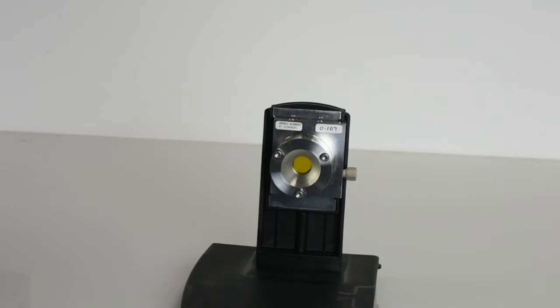The cell has three ports. When looking at it from the front, the exit port is on the top left and the two inlet ports are on the top right and the right side of the cell.